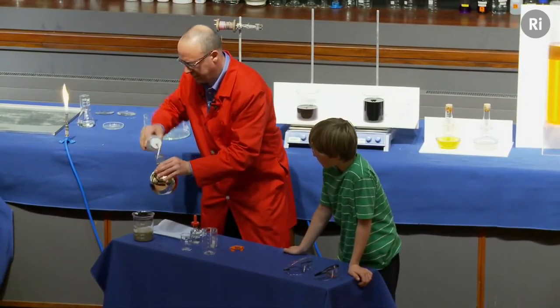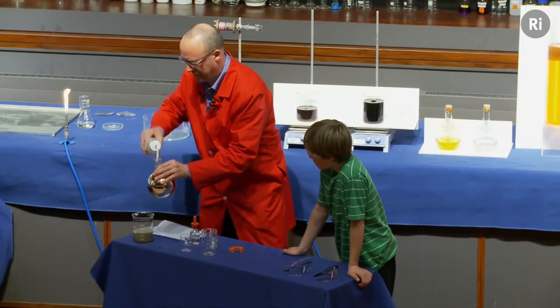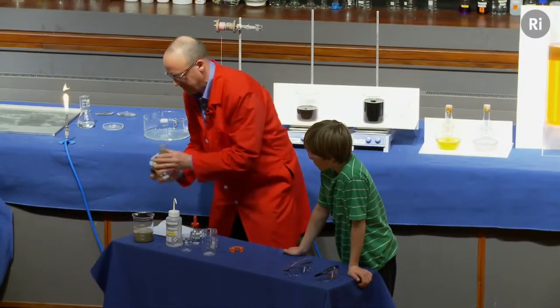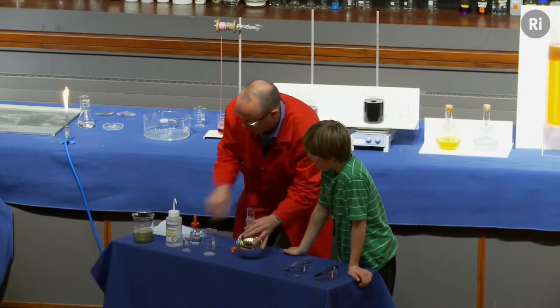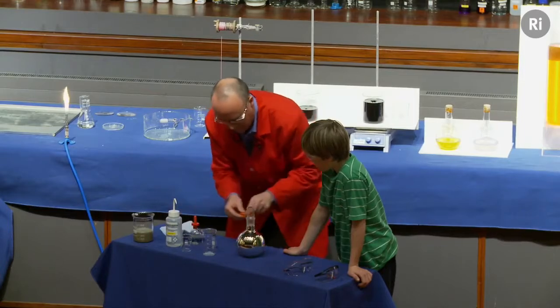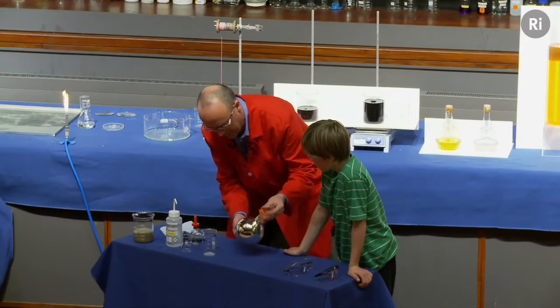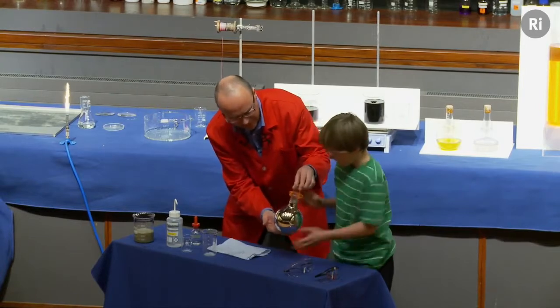I'm going to rinse it out a second time. Rinse it out a third time. There we go. And I'm just going to dry this off. And put the clip back on. And if you'd like to just give that a little polish. There we go. If you'd like to hold it up by the neck, that's it.